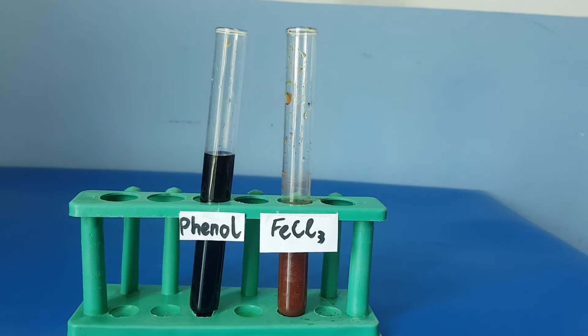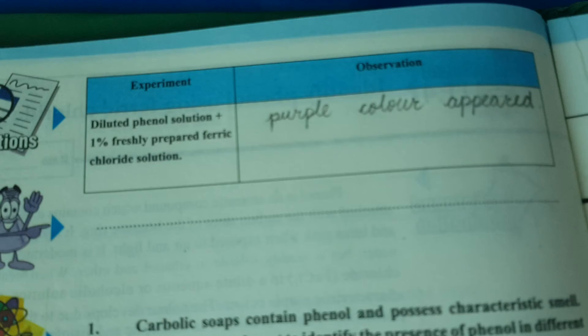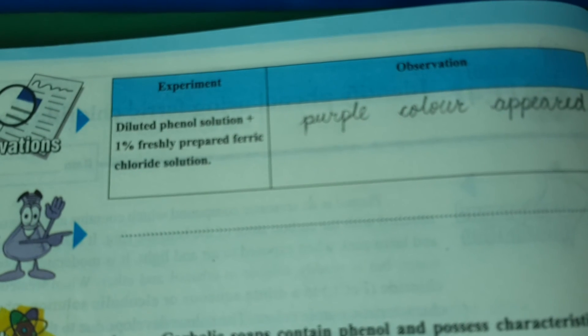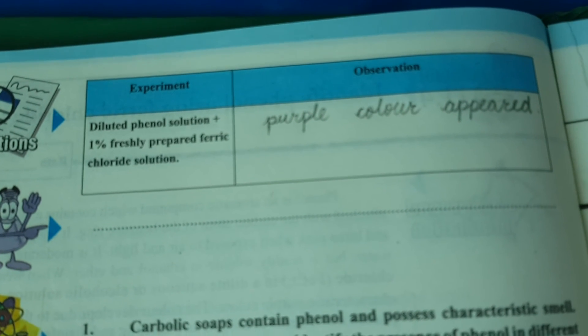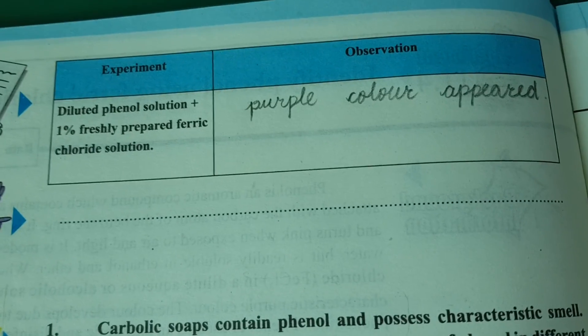We have tested phenol by using ferric chloride, and observed that purple color appeared.